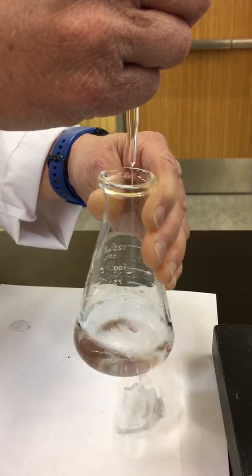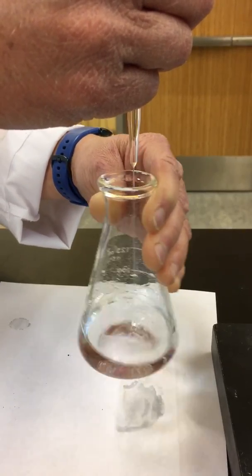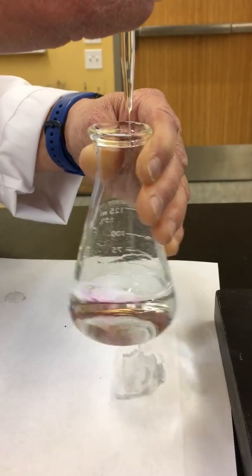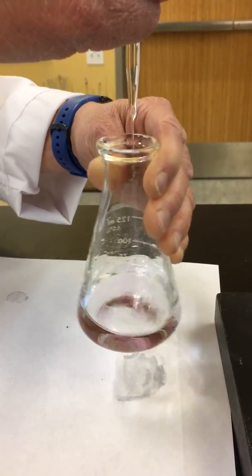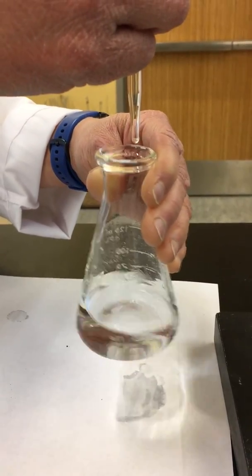And at this point, we want to start adding it a little slower until we reach that endpoint. And we can see the pink color starting to last longer and longer. So we know we're getting close.